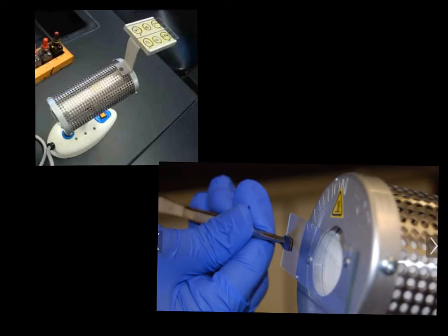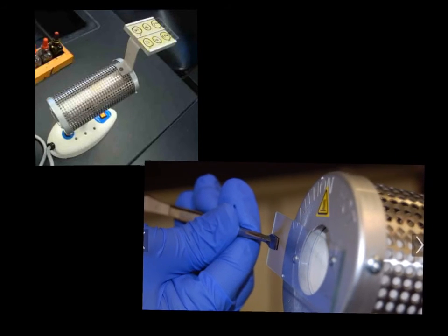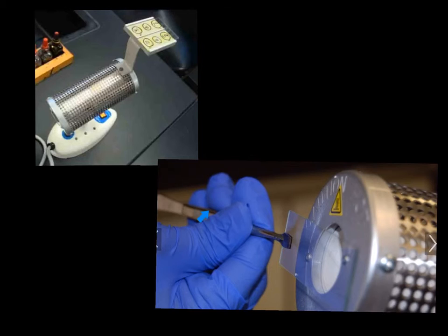Now that our bacteria has air dried, it's time to heat fix the bacteria, and we're going to do this by holding the slide either with some kind of tongs. I tend to use clothes pins and hold them at the tip end.